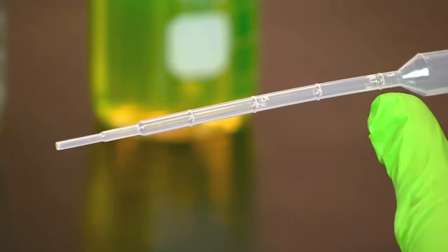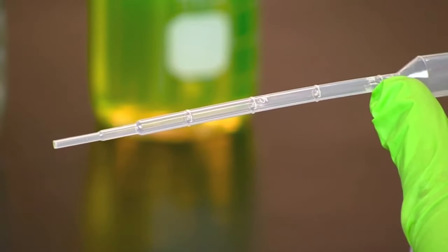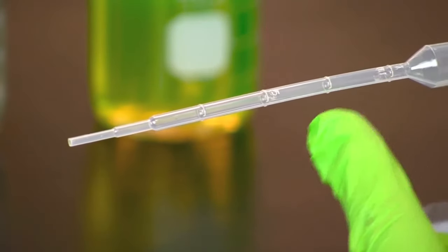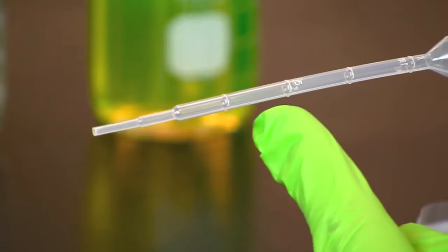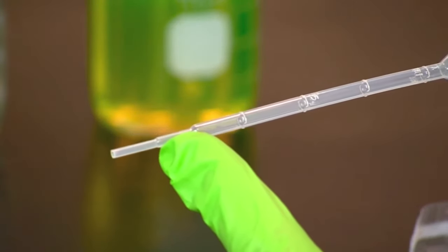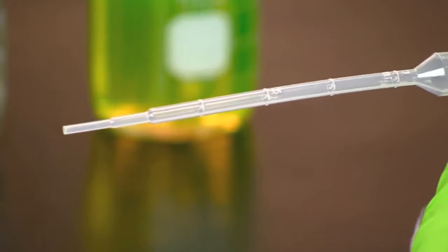Markings on the pipette allow the measurement of 1 milliliter, 750 microliters, 500 microliters, 250 microliters, 100 microliters, and 50 microliters.